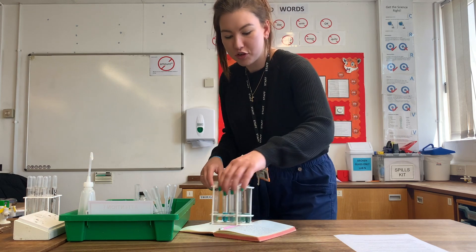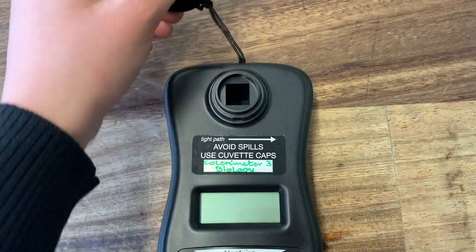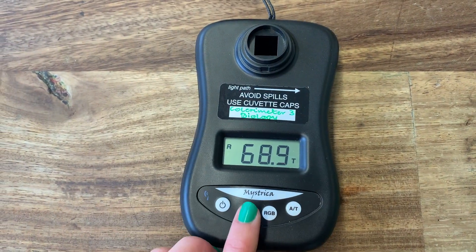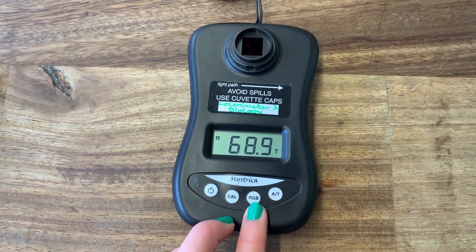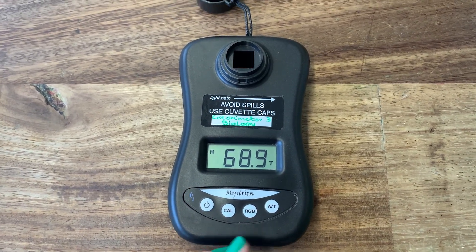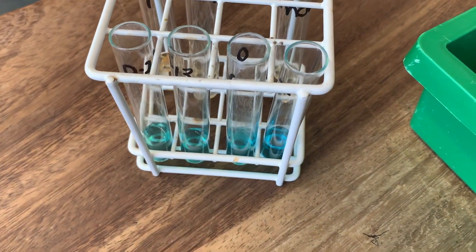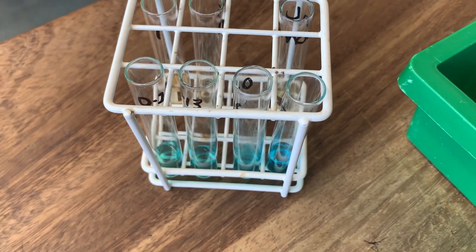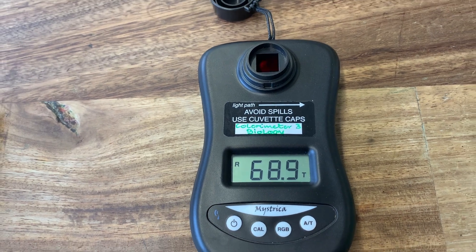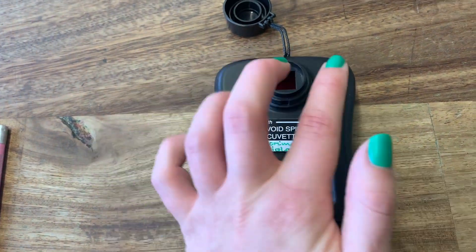I have my centrifuged tubes and next we're going to use a colorimeter. This is where we pop our sample in. The controls: we need to calibrate, our light color must be set to red, and we want transmission rather than absorbance. The reason we're using red light is because our samples have a lot of blue in them due to those Cu²⁺ ions - the red light will be absorbed by those Cu²⁺ ions. This is essentially a way to find out the concentration of Cu²⁺ ions remaining: the more Cu²⁺ ions, the more red light is absorbed and the less red light is transmitted.